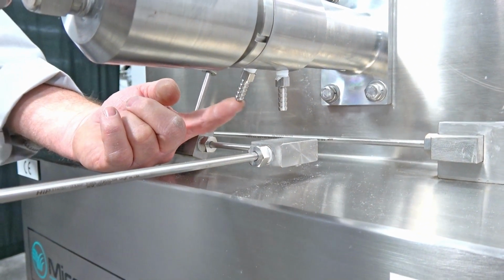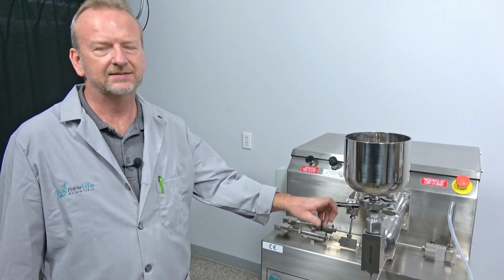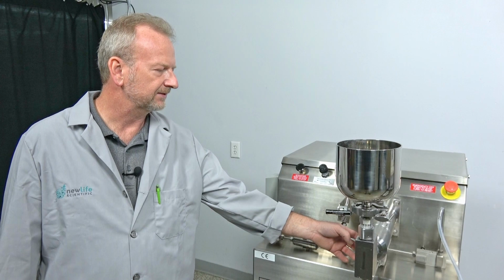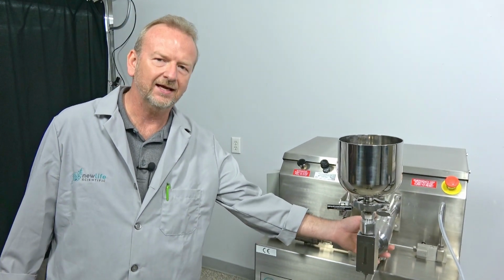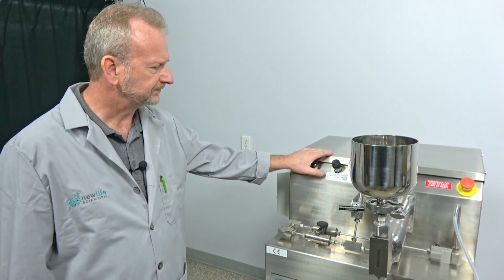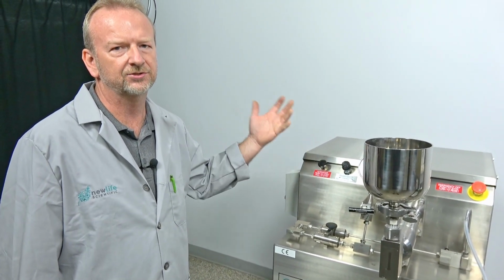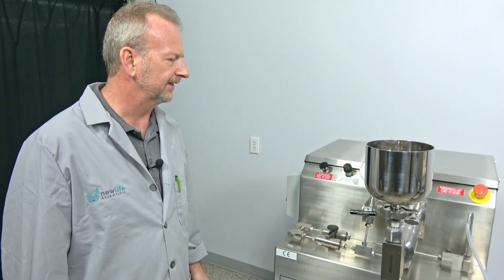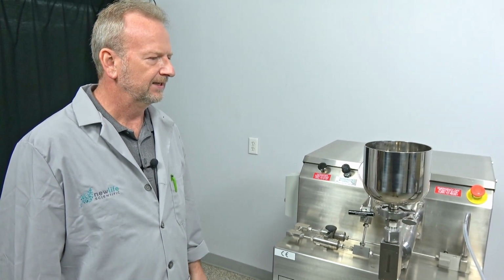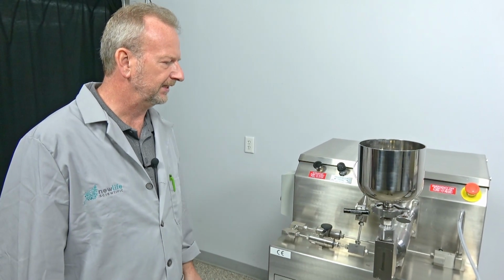So this is the spot where it'll drip. It bypasses the seal, it bypasses the plunger, and it starts dripping inside the cavity in here. So then you basically just shut the machine down. I have a little toolbox, and I'm going to show you some of the tools that you want to keep on hand, and we're going to remove it and show you how to change the plunger seal when we get in there.